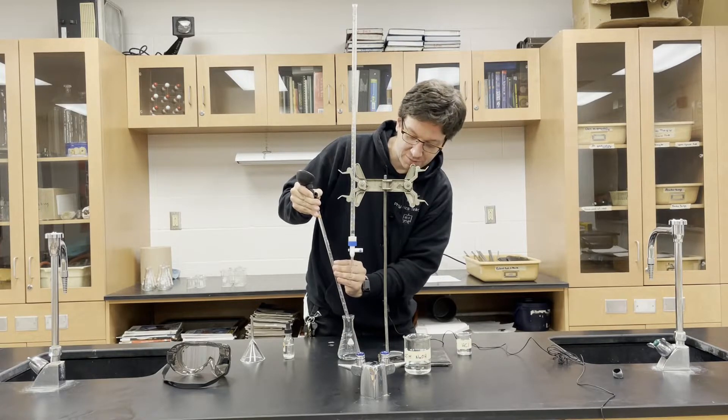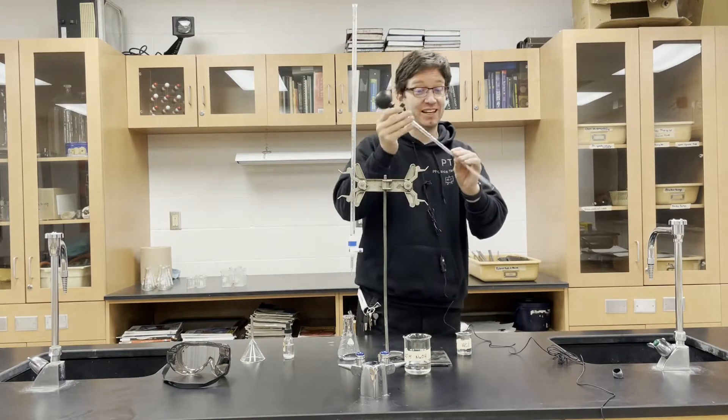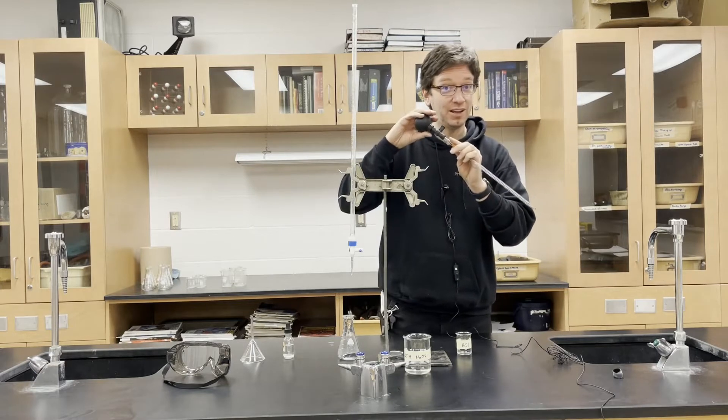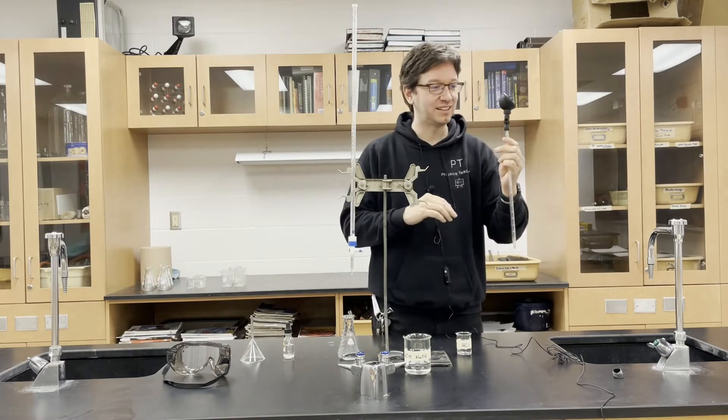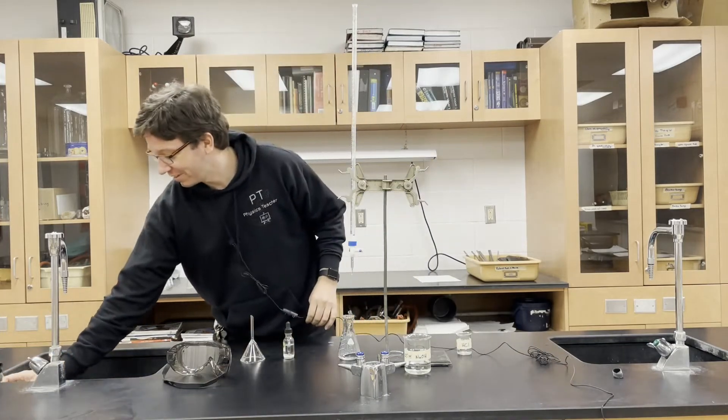Very important with pipettes, you never want to turn this upside down because if you do that, hydrochloric acid can go back into the bulb which can corrode the inside, ruining it. We're going to put that aside for now.